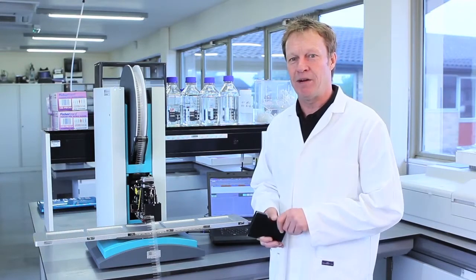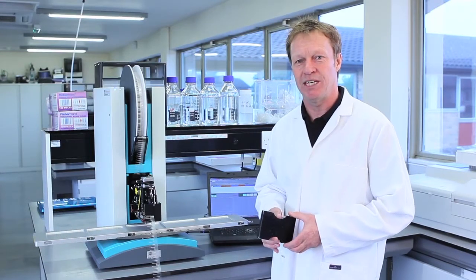Hi, I'm David Smith and I'm going to show you how to calibrate the mosquito using the calibration block. We recommend that you calibrate the mosquito after changing the spool of tips.